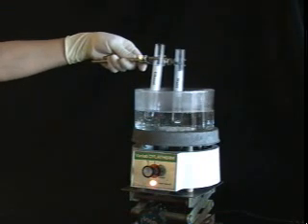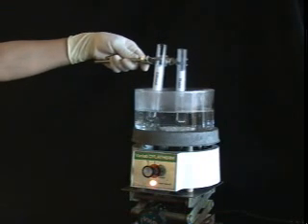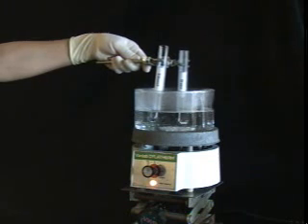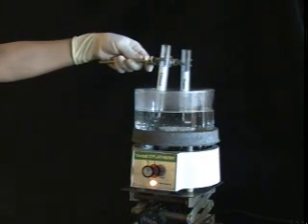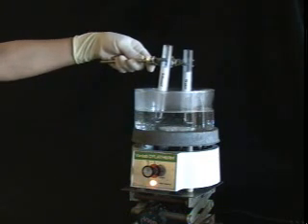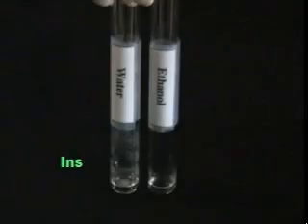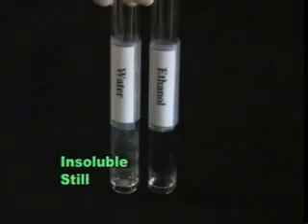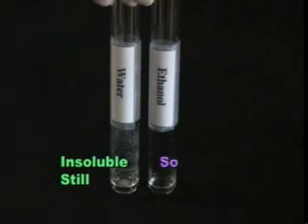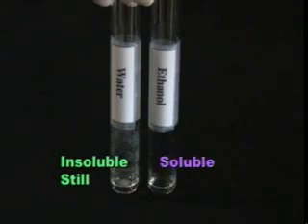If there is still solid remaining, clamp the tube and heat it in the water bath until the solvent boils. Swirl the tube and make note of whether or not the compound dissolves. After heating, naphthalene is still insoluble in water, but it is now soluble in hot ethanol.